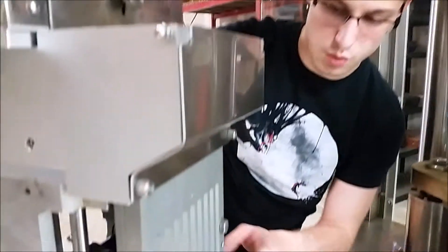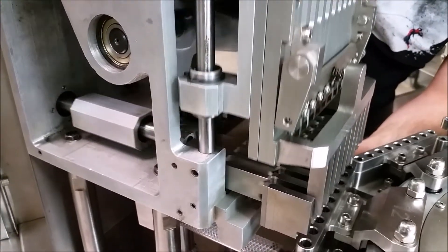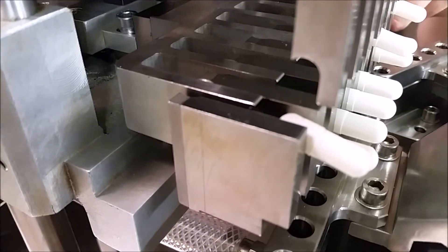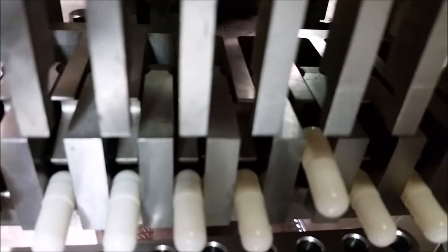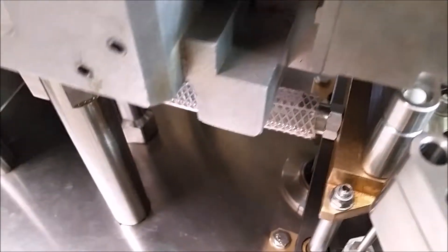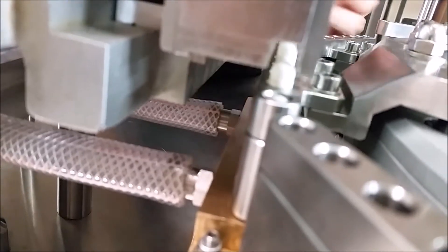Let's take a look at how that's supposed to look. When you see the capsules come out, the horizontal forks push them out and you want to see the vertical forks coming down right at the center of the capsule where the top and the bottom are connecting. When that happens, they will rotate correctly and then go into your segments. You want to adjust so the capsules are centered and aren't falling too far out or too far into the segment hole.